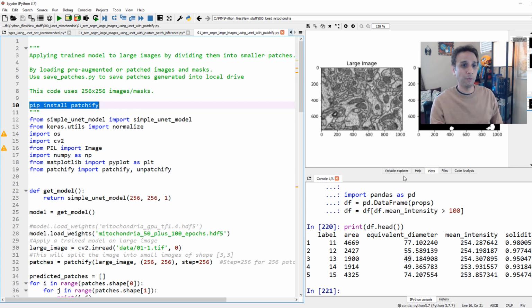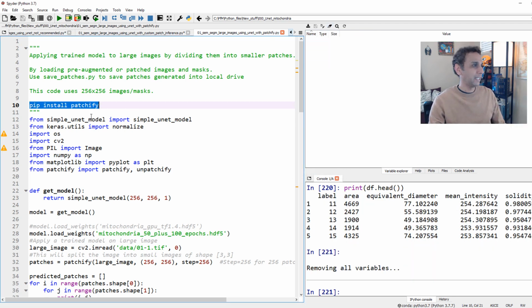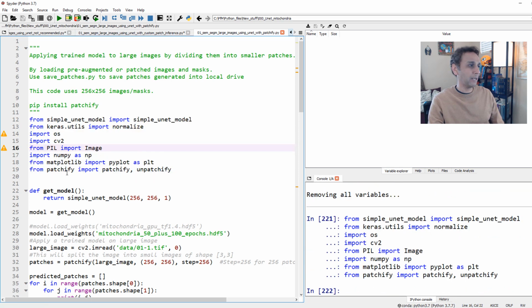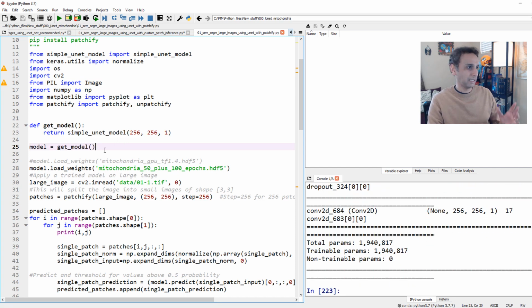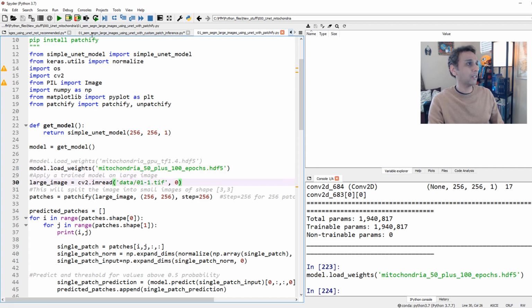And let's walk through this code one more time. Let's remove everything from here. And I installed this, and you should not have any issue installing this Patchify. And let's go ahead and import all the libraries, and you see from patchify, I'm importing patchify and unpatchify, right? So I want to create patches, I want to unpatch them, meaning putting them together. This part is pretty much the same as from the last section, the one that we just finished. We are getting the model exactly the same. We are loading the same weights that we saved, and I'm loading the same image here.